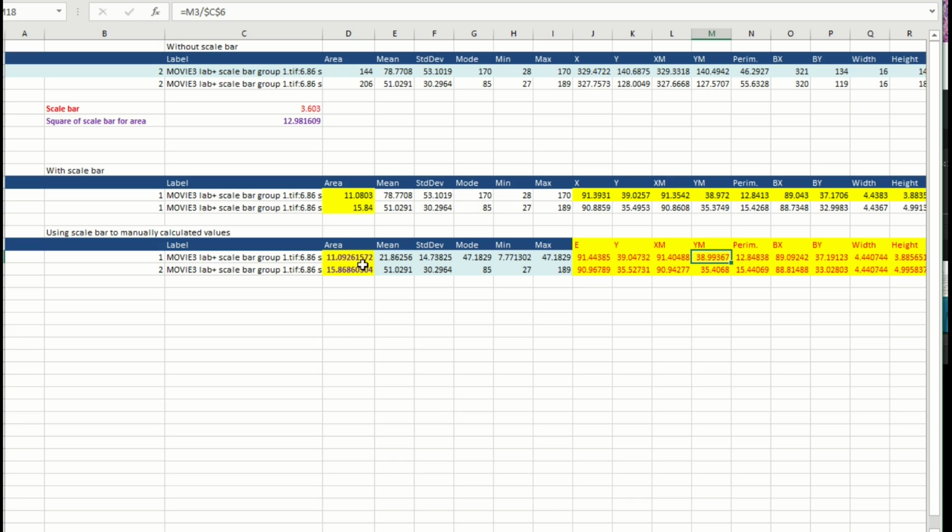Now for the area, you need to have a square here because the area is measured in squares. So you multiply the scale bar, the C6, by the C6. So 3.6 multiplied by 3.6, you get 12.9 and some values. And here you do exactly the same thing. You take the 144 divided by 12.9, D3 divided by the dollar symbol, so you can drag it.